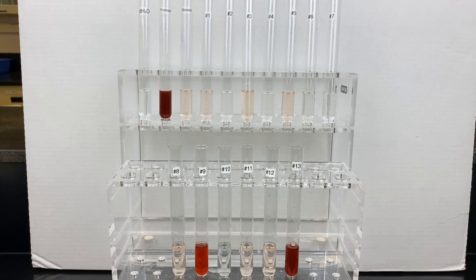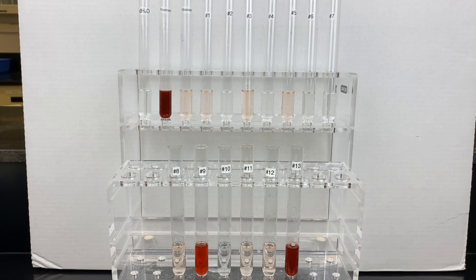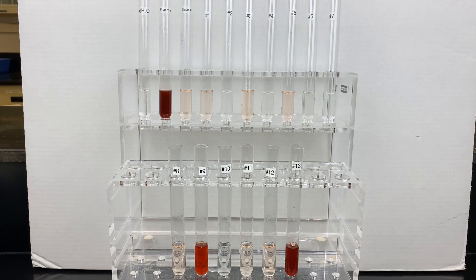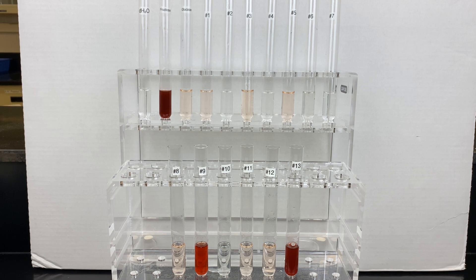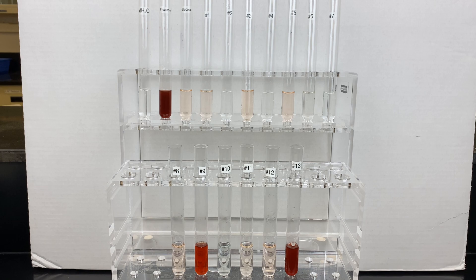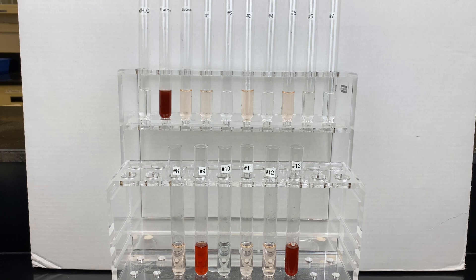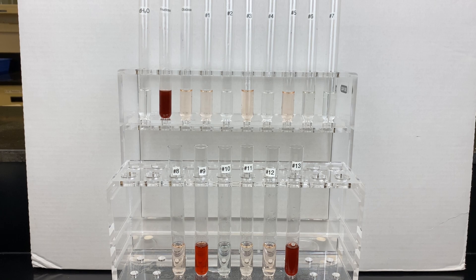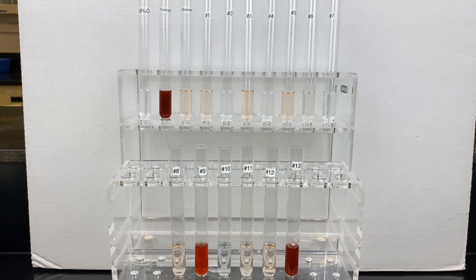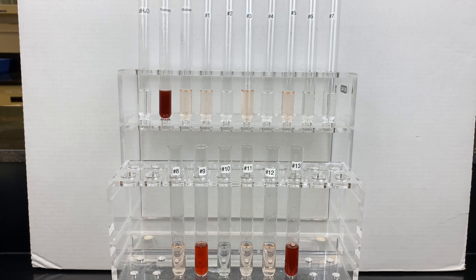Here are our samples. You can see very different reactions for some of the tubes. We have our controls — water, fructose, and glucose — and we have our 13 unknown samples.